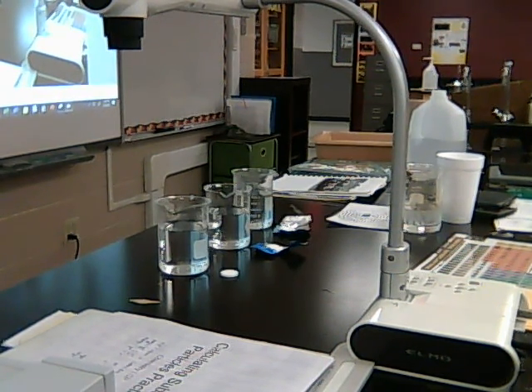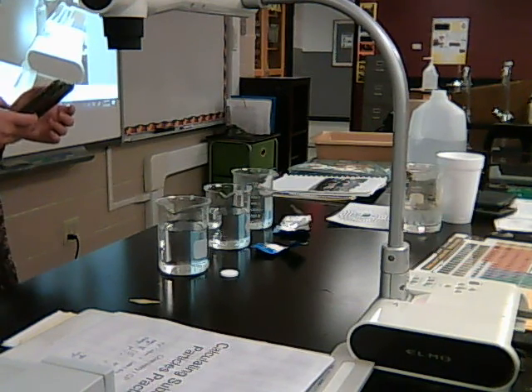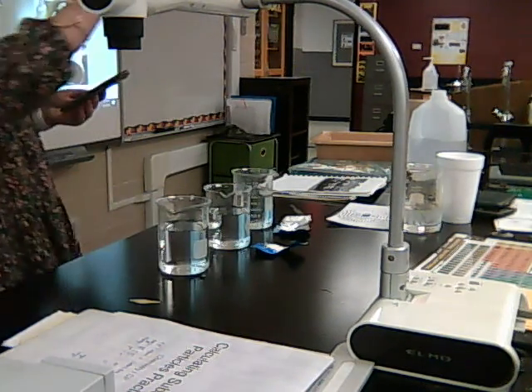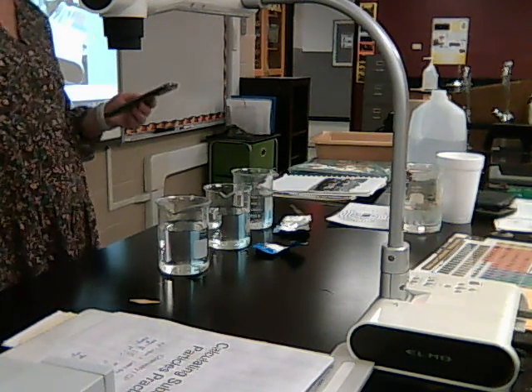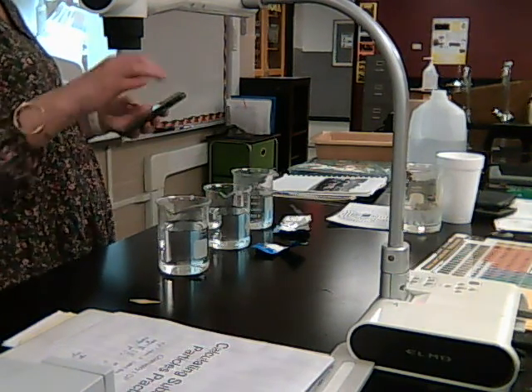And I'm going to go ahead and start with the cold ones. And let me find my timer. No, stopwatch. There we go. All right. So since I have the whole tablet here with the cold one, I'm just going to put the whole tablet in the cold. Okay? And then as soon as I drop it in, I'm going to start, and then I'll stop when the tablet has disappeared.